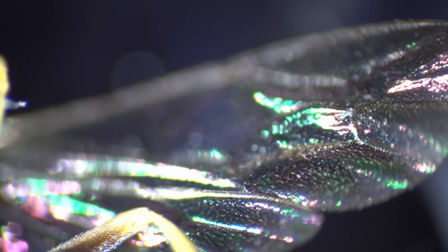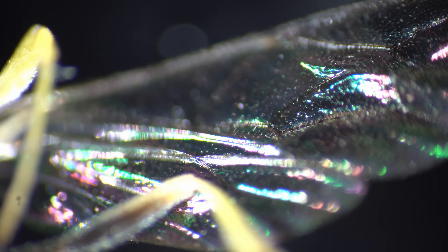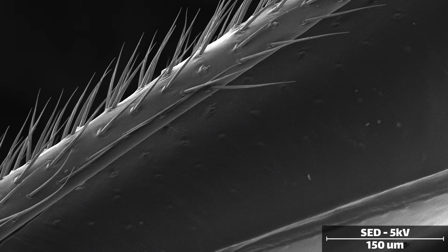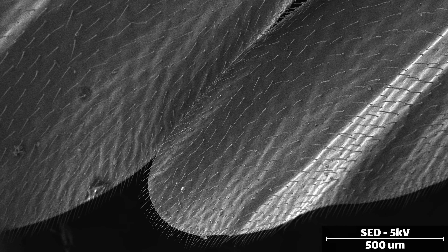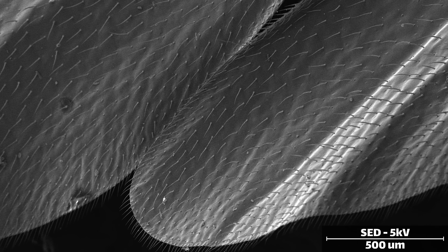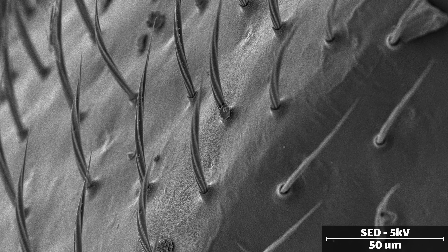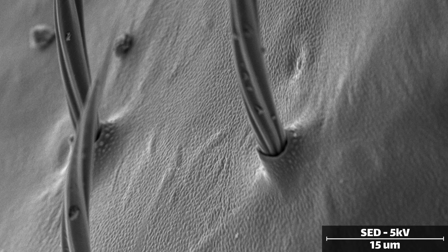When looking at the wings under the optical microscope, we can see they glitter and cast an iridescent sheen, so I was expecting some sort of small periodic feature like on butterfly wings. But under the electron microscope, we can see that they are remarkably smooth — stippled with hairs and covered in a fine texture, but no periodic structure like I was expecting.